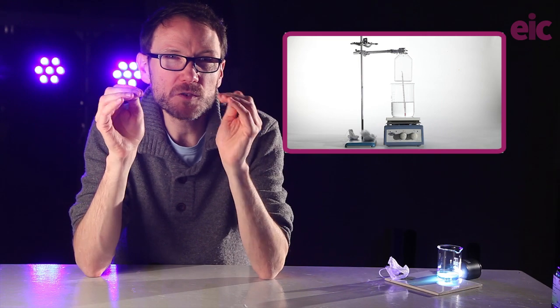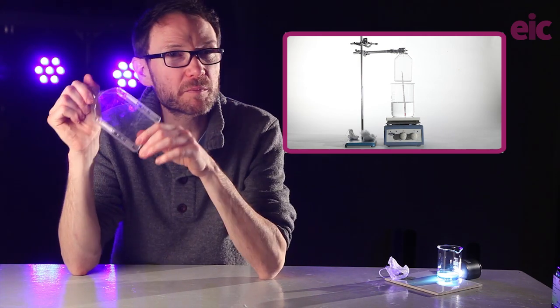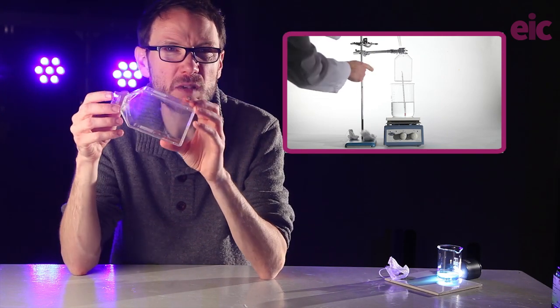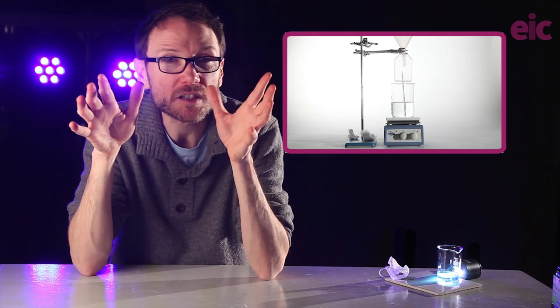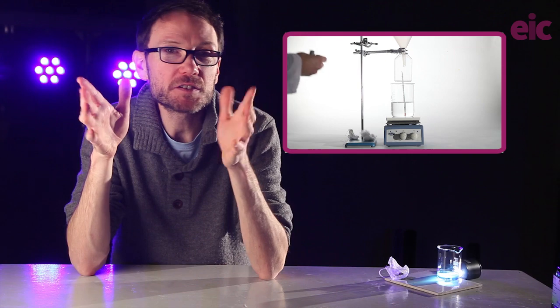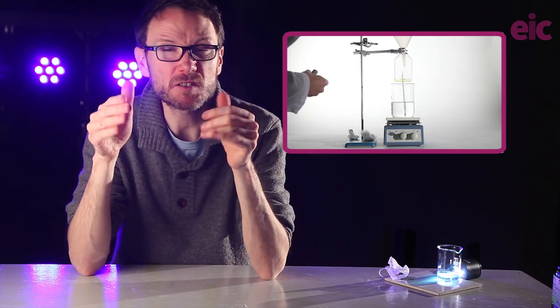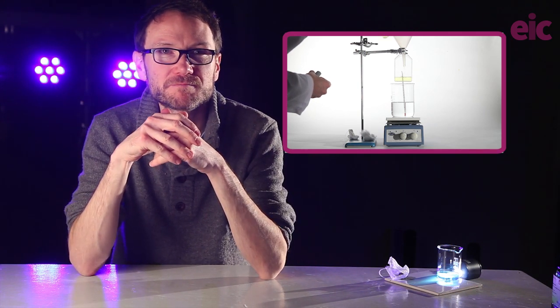If I have just enough water to float the cell culture flask, that's one of these, away from the base, then I know that there's absolutely no risk of the polystyrene that this is made of, a melting point somewhere over 200 Celsius, that's not going to deform. If you don't have one of those flasks, a 250 ml conical flask works as well, but I do like those flat surfaces for good color clarity.